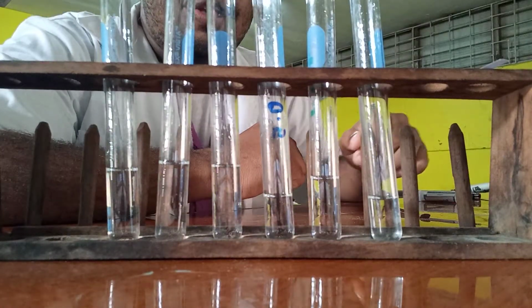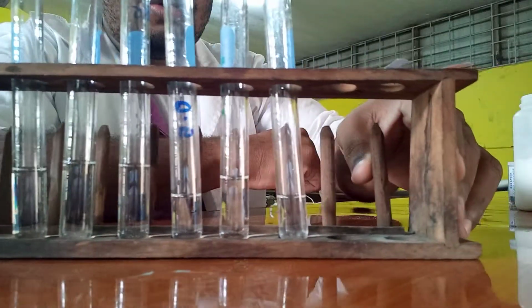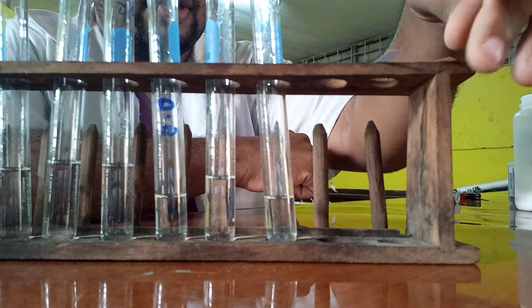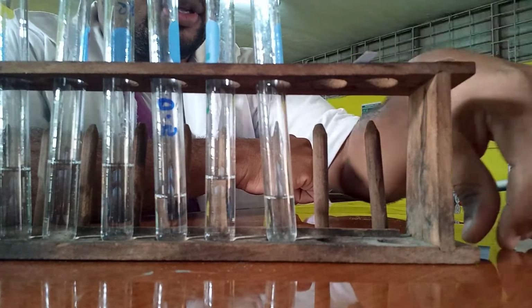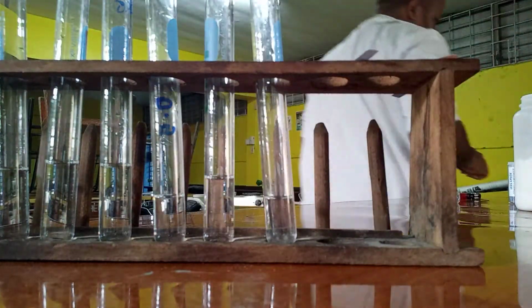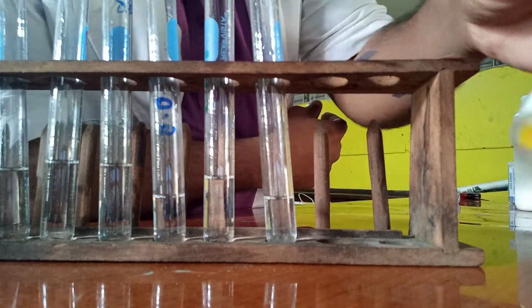Right, in this video, we're going to look at the properties of acids. So, I have three pieces of paper. I have red litmus paper, I have blue litmus paper, I have cobalt chloride paper, and I'll get another paper. And then now I have pH paper, which measures 0 to 14.